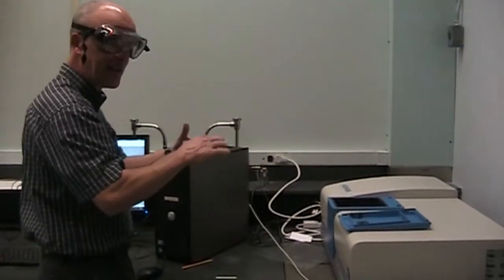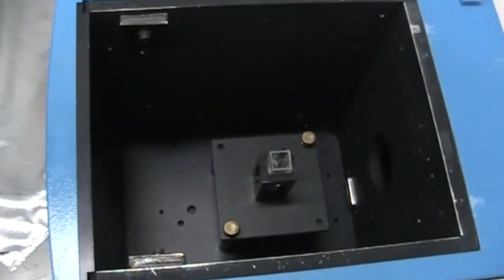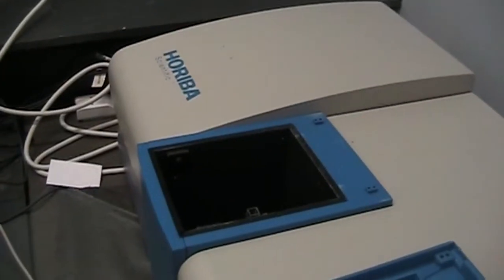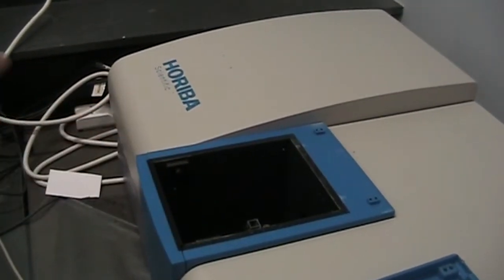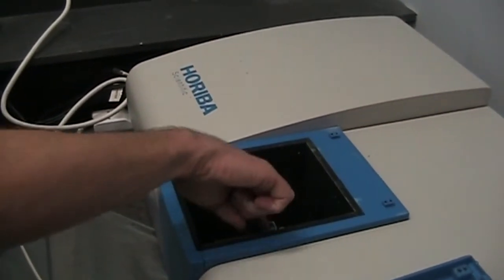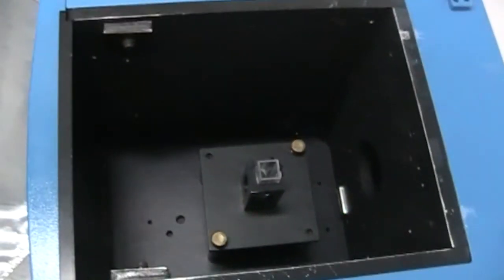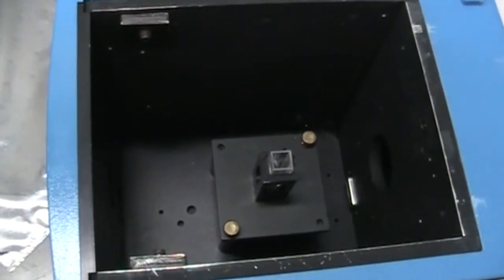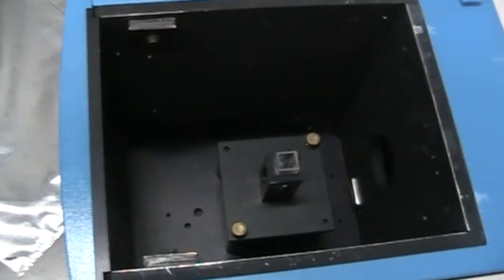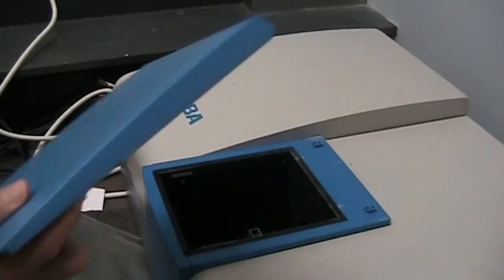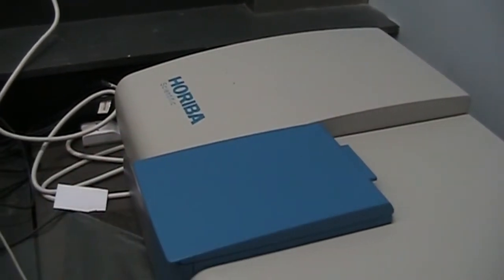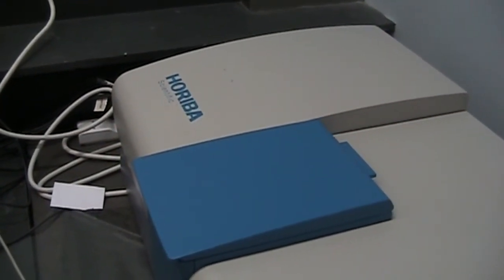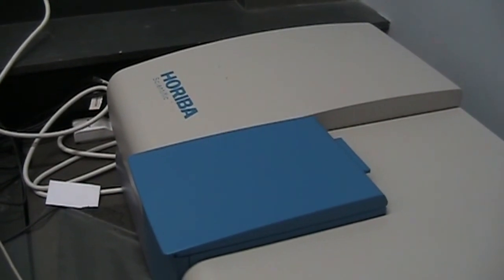Because we have the four clear sides there's really no proper orientation. As long as you put it in you'll be fine. So as you can see with the four clear sides it doesn't matter how the cuvette's oriented. And you can also see the two windows—one for the excitation light coming into the sample, and then one for the emitted light to go into the spectrometer and be analyzed. So you put the cuvette in place. But it is important that we have it light tight, so we do put the lid back on. And then we go back to the instrument and ask it to do the scanning.